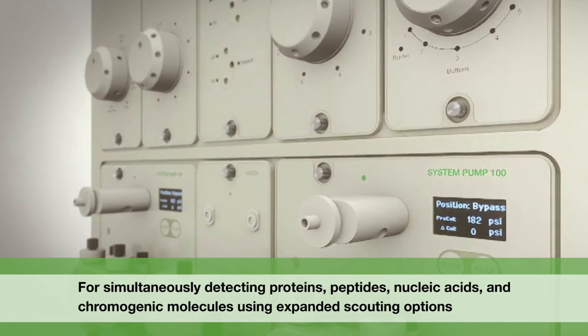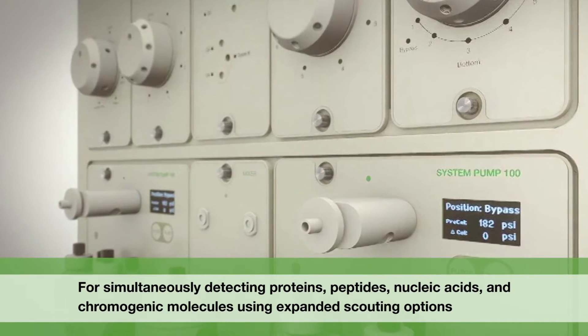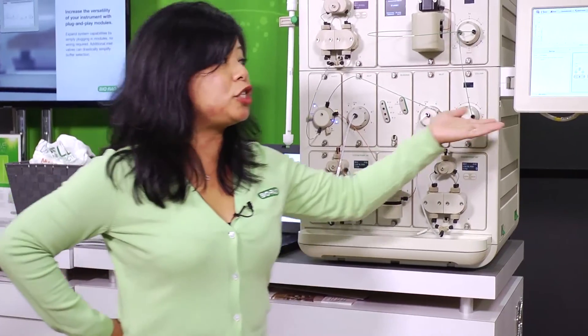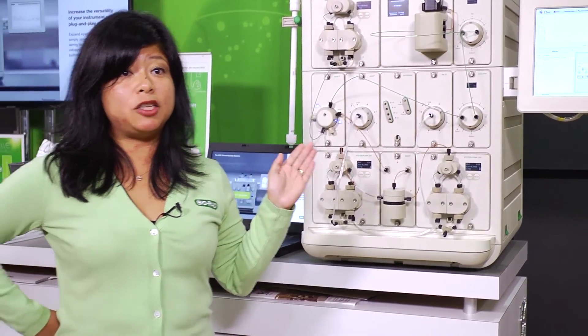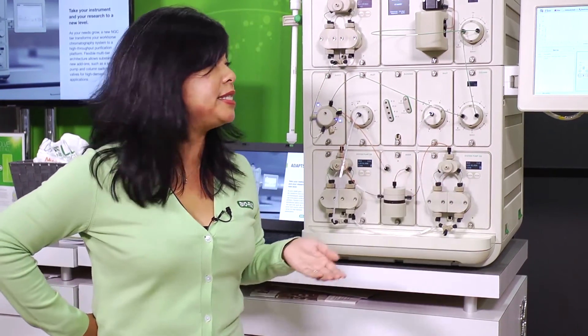Lastly, the outlet valve also comes with the Discover Pro system. What you see here is a touchscreen — once you create your method on the PC, you can send it to the NGC system and run everything via the touchscreen. You can run manual methods as well as methods you've already written into the system.